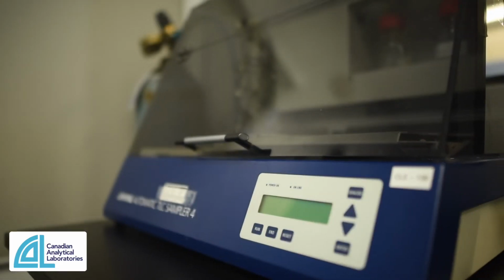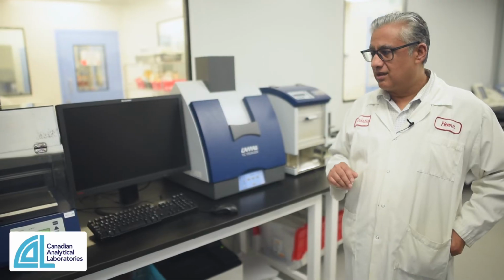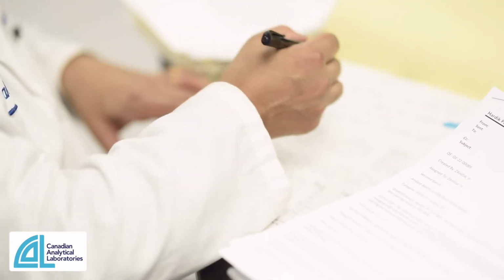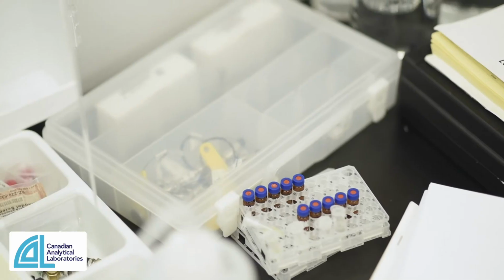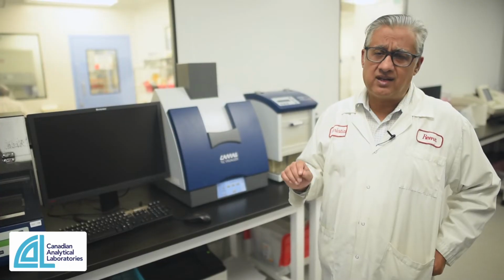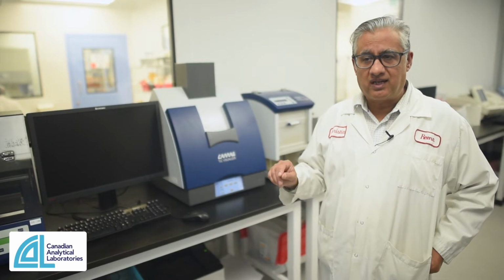And then again, on the botanical side, we have HPTLC, which allows us to measure qualitatively identification of different botanical ingredients. For those of us that know Cal, we started in natural products, so we have a wide range of experience with botanical identification. And whether it's a crude herb, an extract, or a standardized extract, we have developed many methods to identify these botanicals.